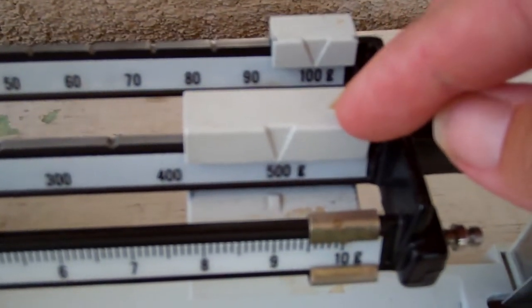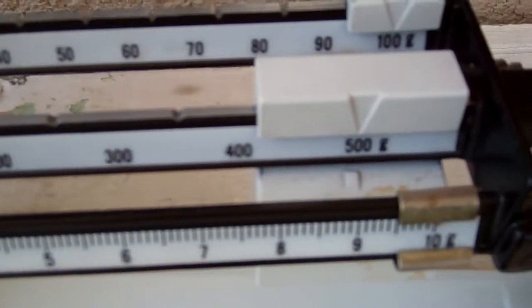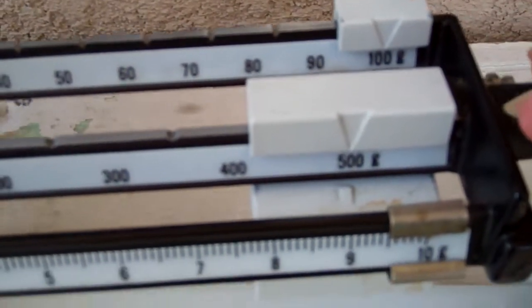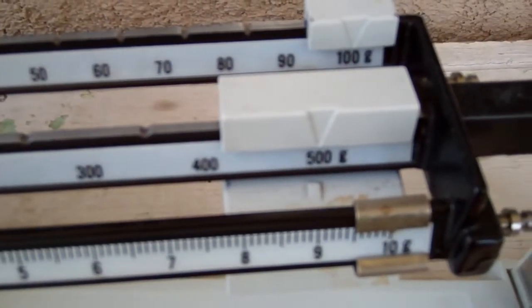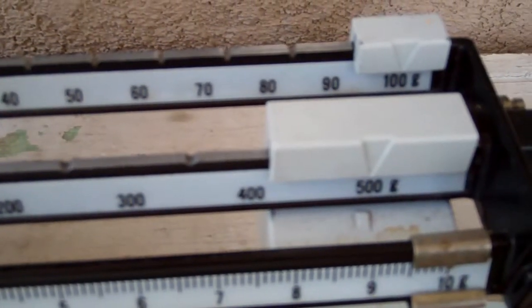And if you look at this, this has got 500 grams here. 100 grams there. And then there's 10 here. So five, six, 610 grams. That's all you can get on here.